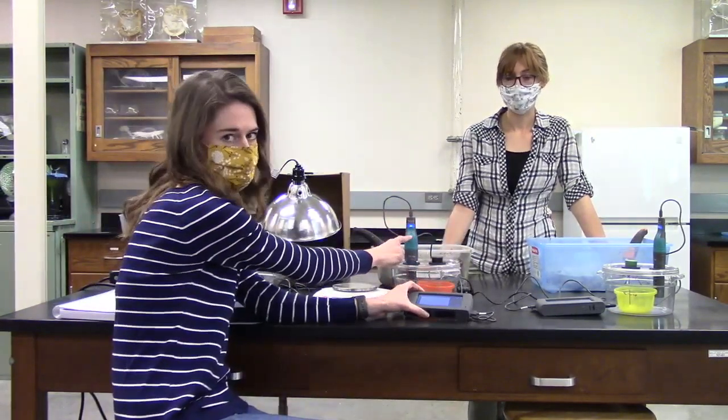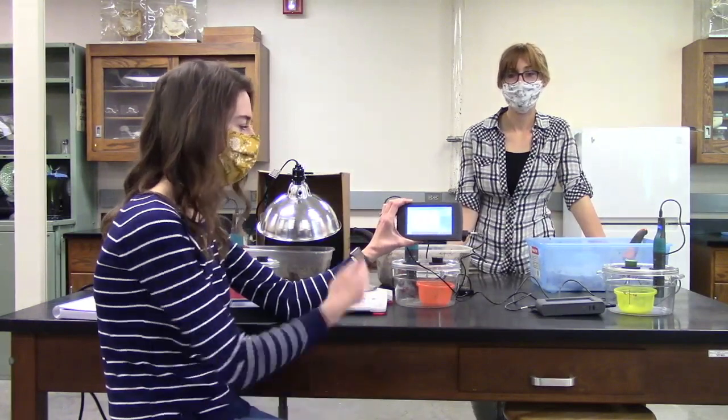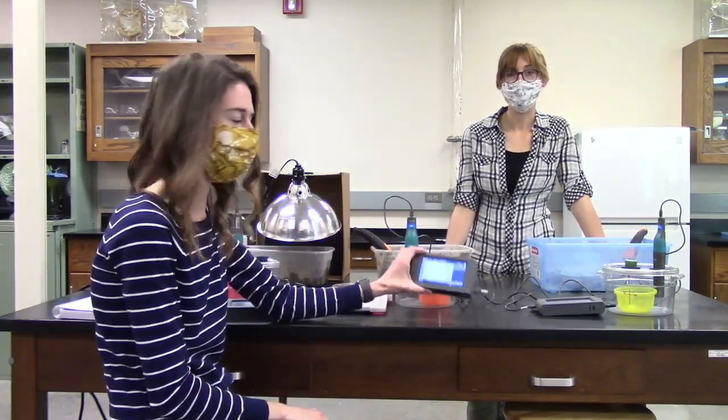So think about what you might expect to see today, and we'll go ahead and show you how we measure these things. For each of these chambers, we have a CO2 sensor hooked up to it, and we have these little computers that are meant to work with these CO2 sensors. They put off a graph, and we're allowing this to go for a few minutes without any soil in the chamber, so we get a good baseline just to make sure that our CO2 sensors are all working.